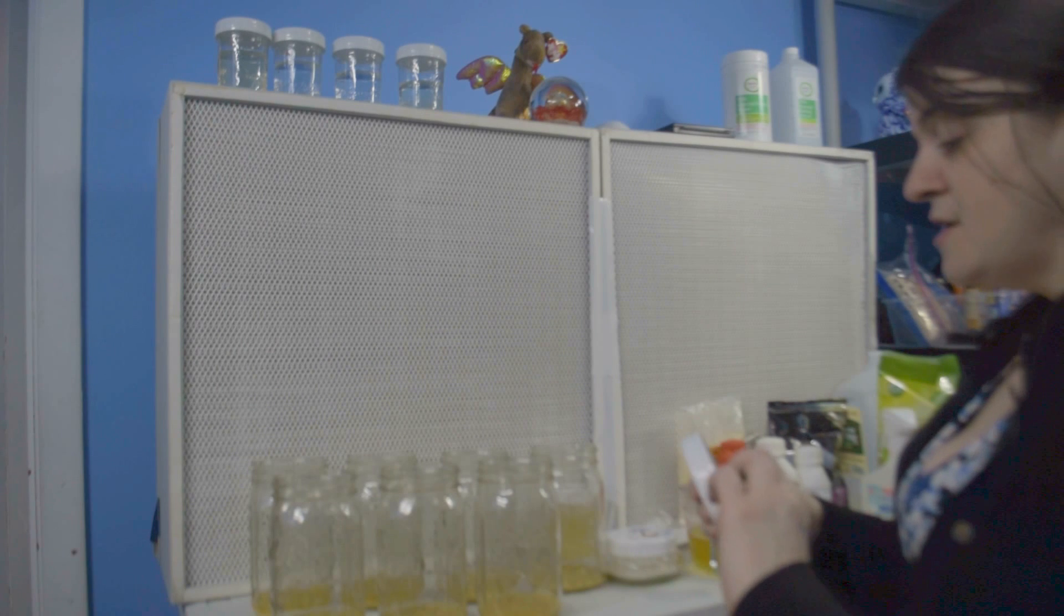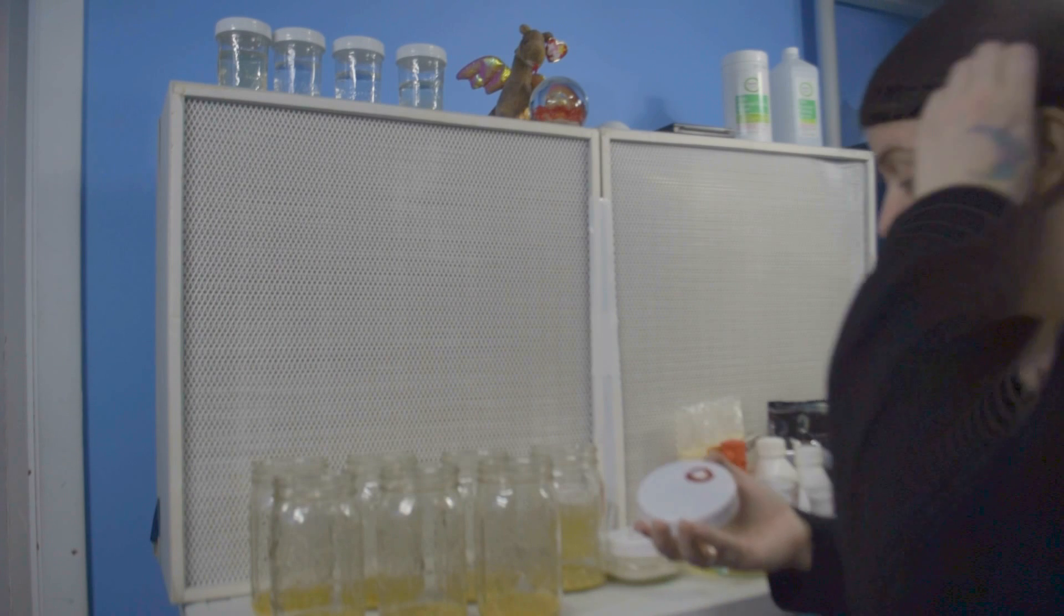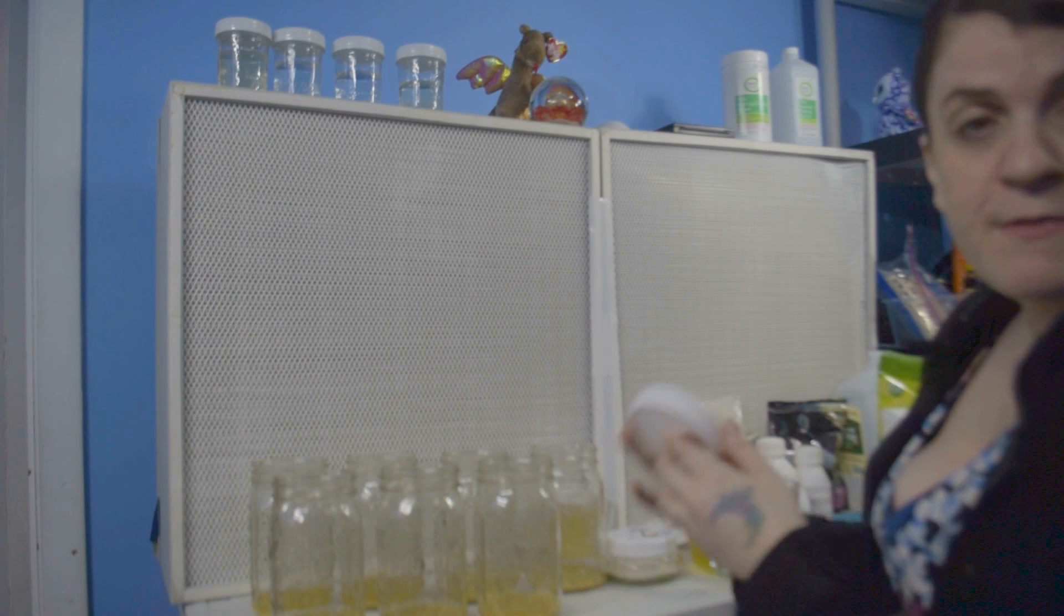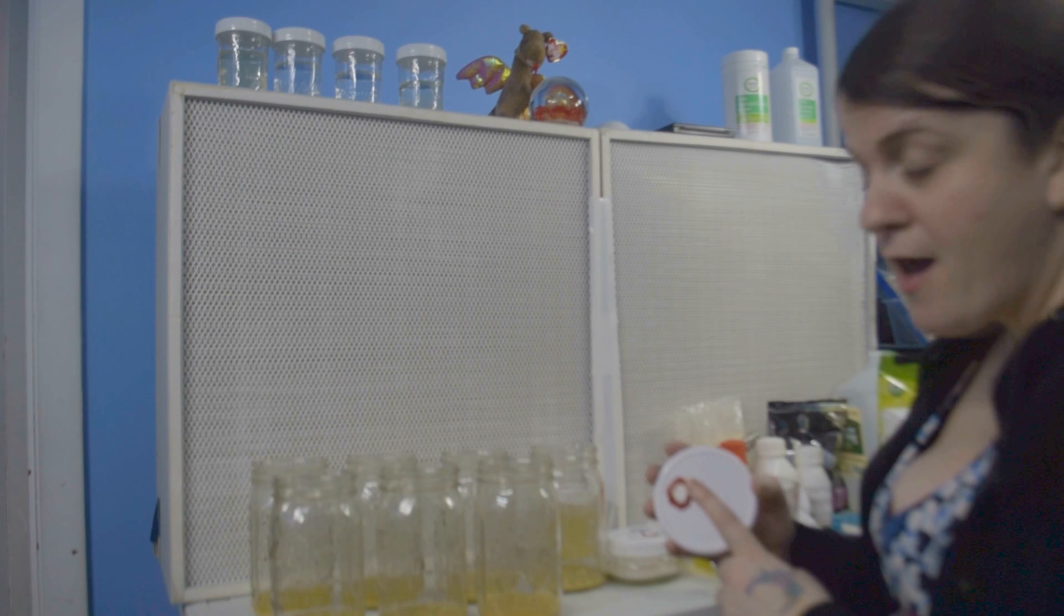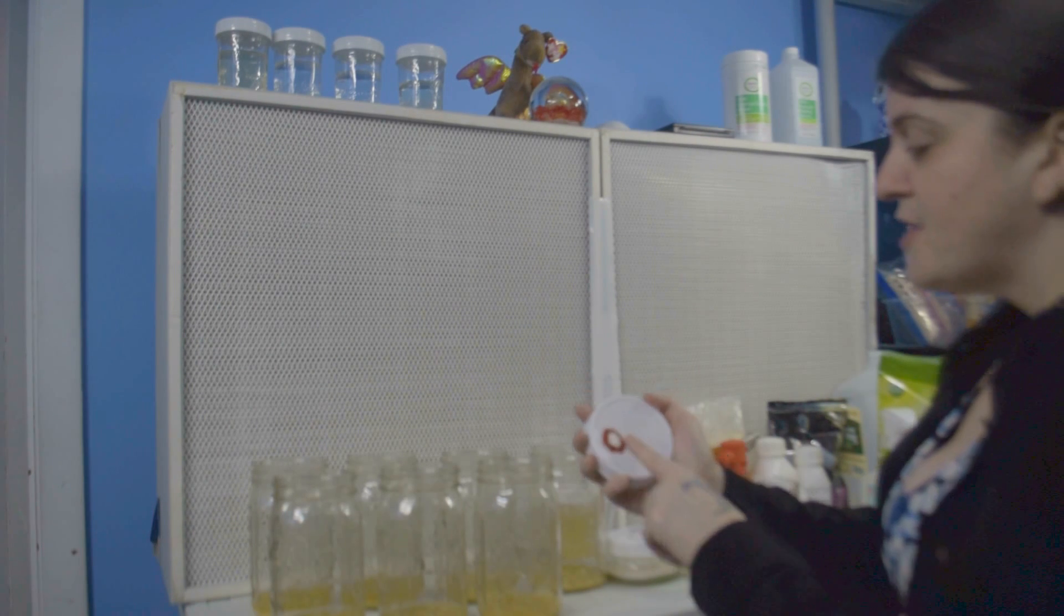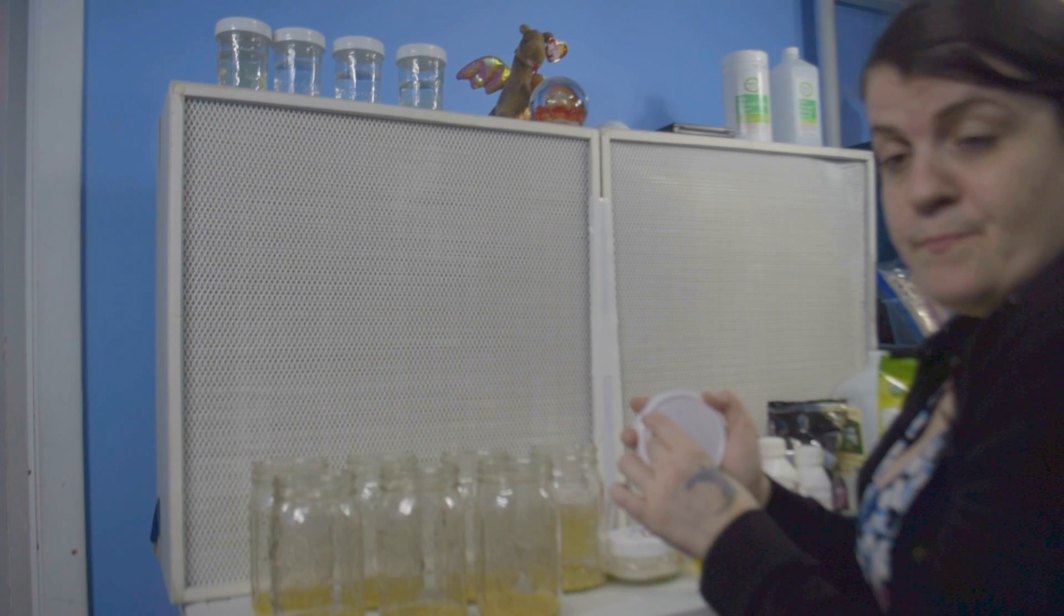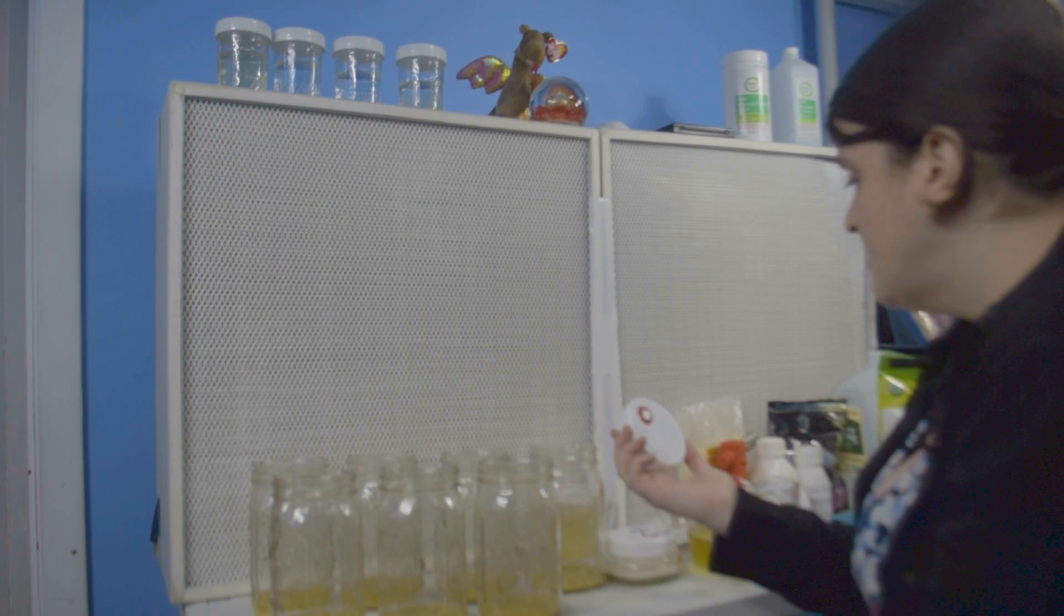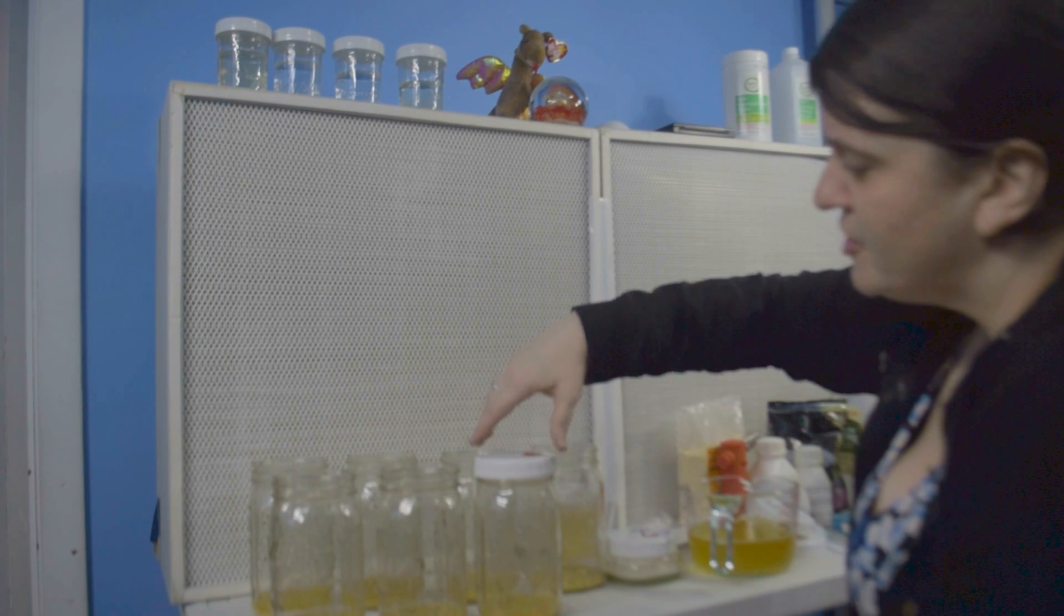And for my jars, I like to use these plastic ball lids. They're very cheap. You can drill a quarter inch hole in there. And as you can see, I'm really messy with my RTV. I just get this stuff everywhere. It's RTV silicone. And these are just some filter discs that I got online and cut into little dime sizes, and I just glue them on there. People have suggested using unmodded lids where you just leave it loose.